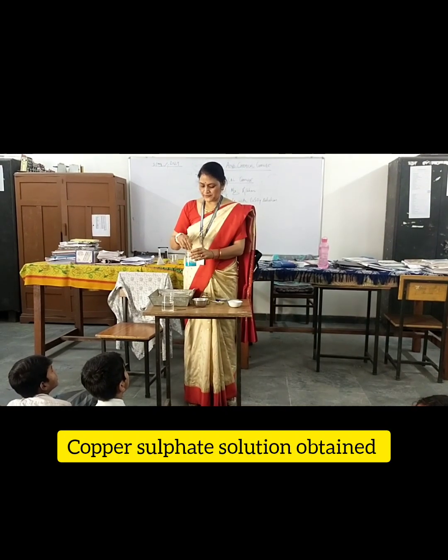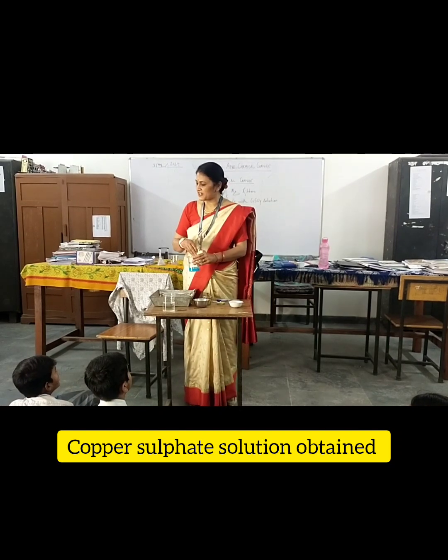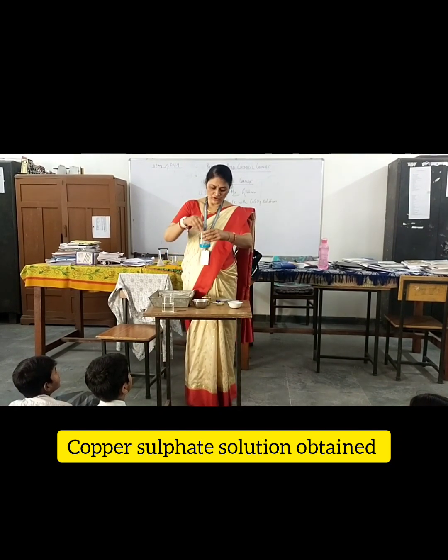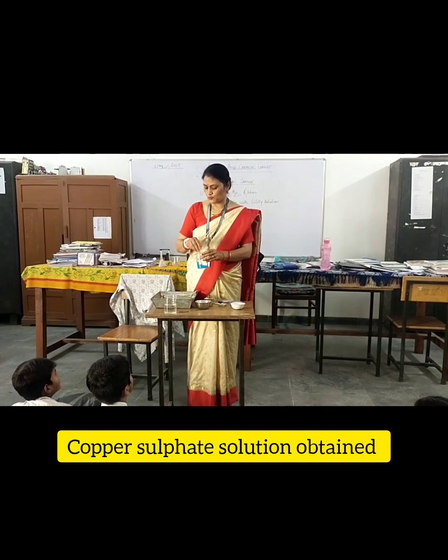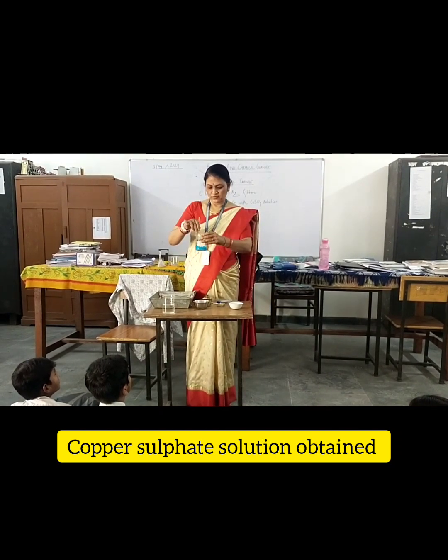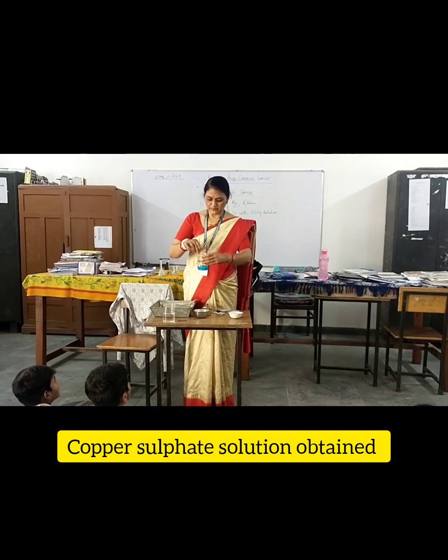We will keep it today and we will see it tomorrow — a change in colour. It will take time. And this is the last period so we will see it tomorrow, meaning next week, whenever we come.